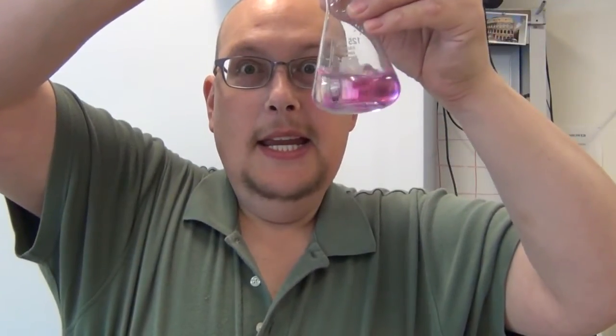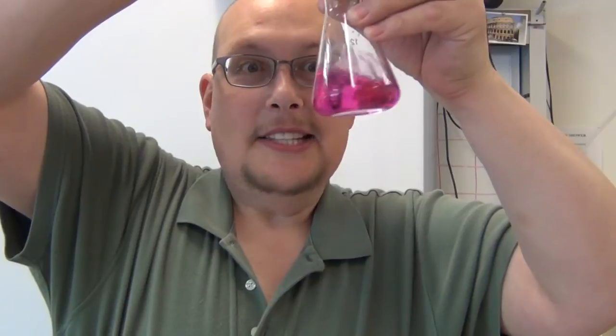Hey, let's try it again! Put a little bit more base in. Whee! Let's get it nice and pink. Yeah, look at that. That's pink.